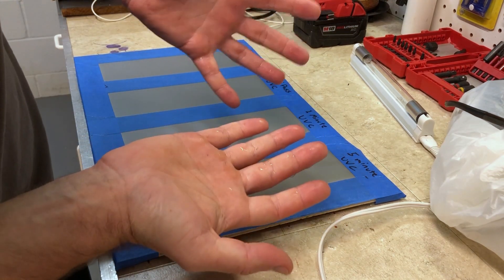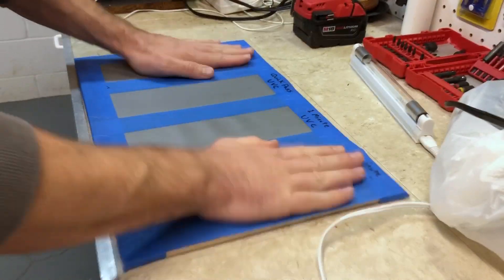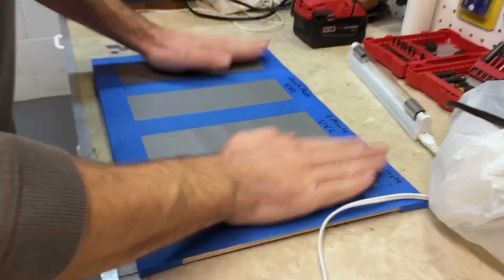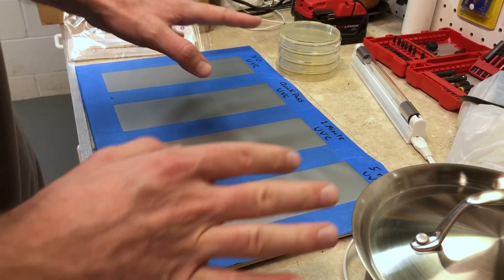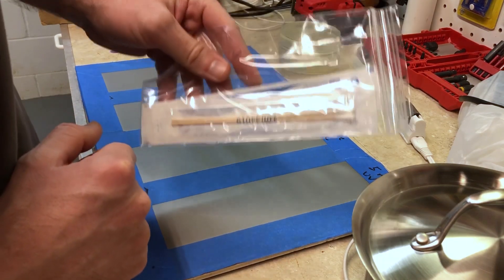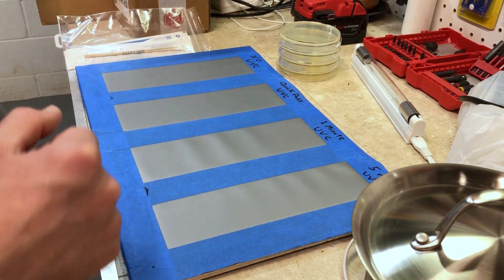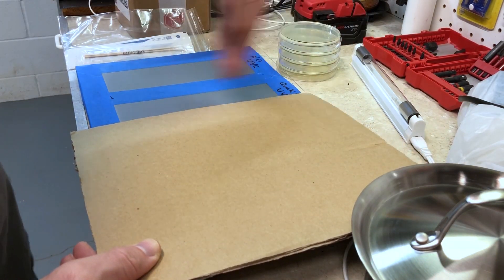My hands are all germed up — all I have to do is touch all these panels. Now that I've got my hands washed, I've got everything set up: boiled water, nutrient agar plates, and sterile cotton swabs. I'm going to swab the panel where we're not using any UVC light, then cover up the other two panels and make a pass with the UVC light over this one.